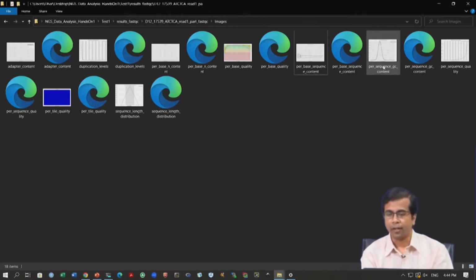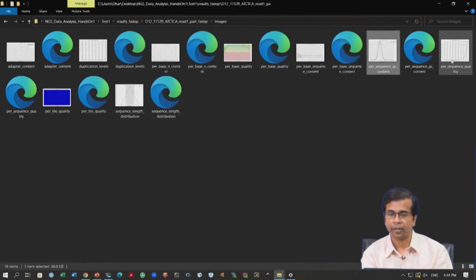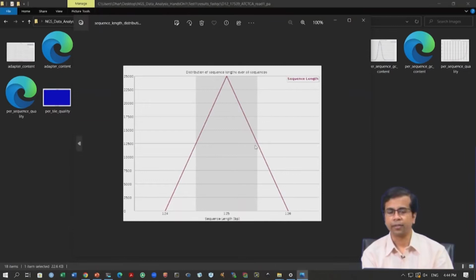We can look into the other ones, per sequence GC distribution. For example, we can see per sequence quality, this is an important parameter, and what we see is most of the reads are of very good quality. They are above 30 and there are very few which are below 30, but they are all above 25. This is the average quality score of the read and this looks very good. We can look into the sequence length distribution, and it is 125, which is expected for Illumina. Sequence length distribution will get reads of the same length.